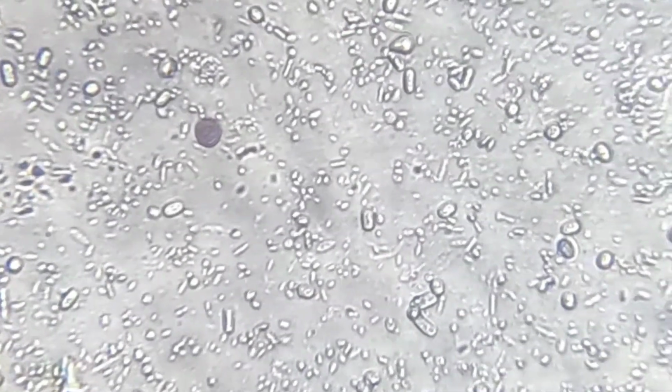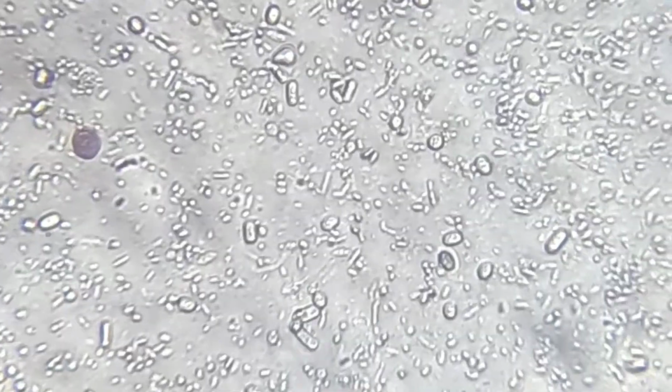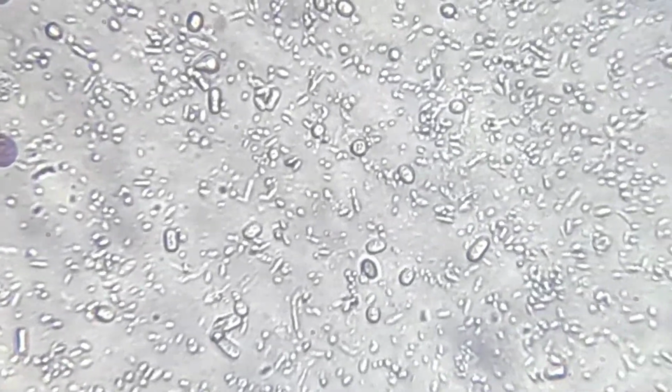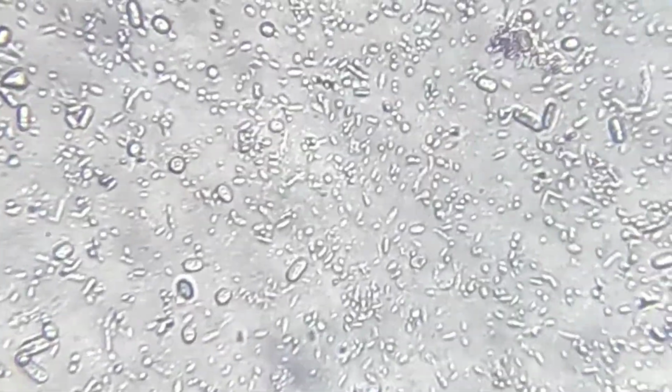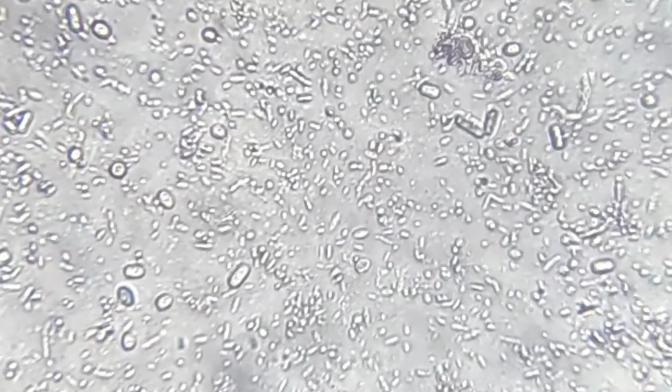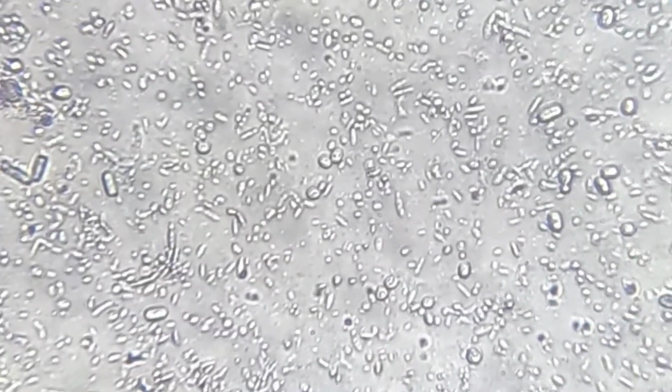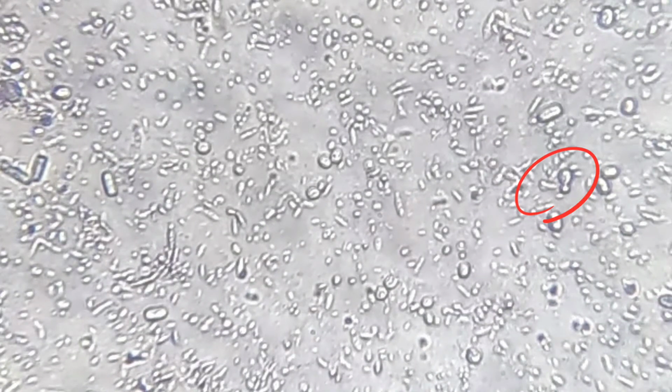The larger oval organisms are called yeast cells. Yeast naturally lives on the surface of grapes. When grapes rot, the sugar in the fruit becomes food for them. They multiply very fast. Sometimes you can see a big yeast cell and a small one budding from it, like a mother and baby connected together. This budding is how yeast reproduces.